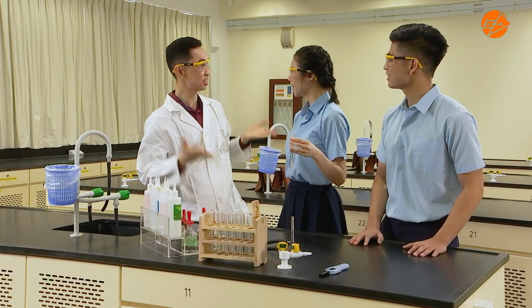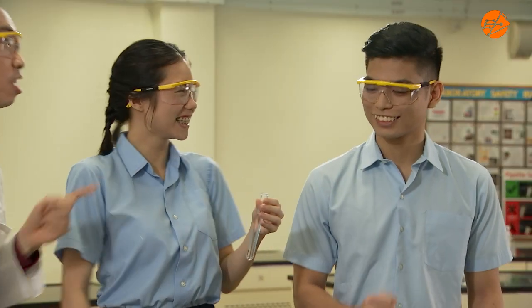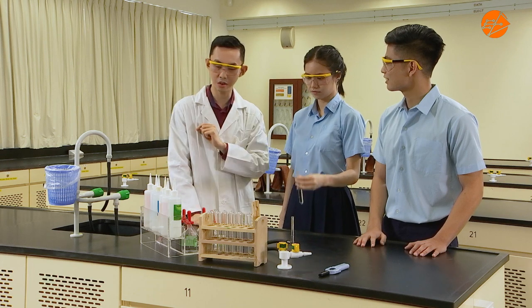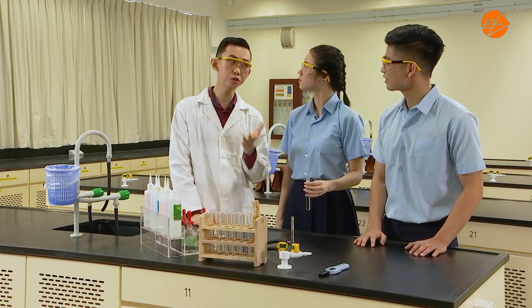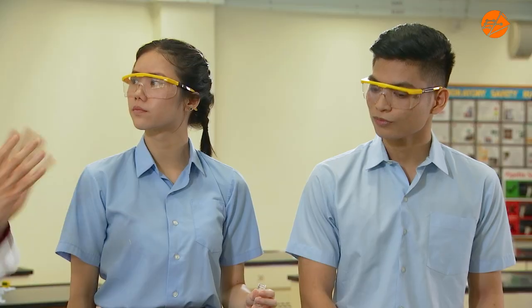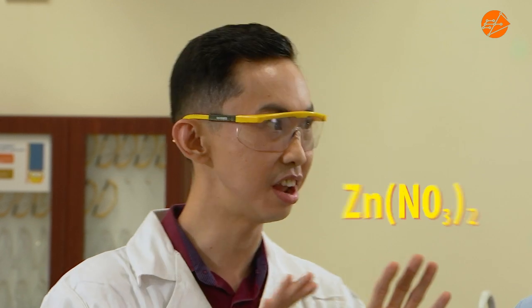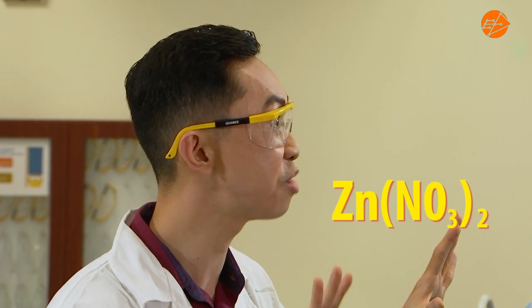So have we found the mystery? Yes. Well done, guys. Since we know that the unknown bottle contains zinc cation, we can also conclude that the bottle without a label contains zinc nitrate.